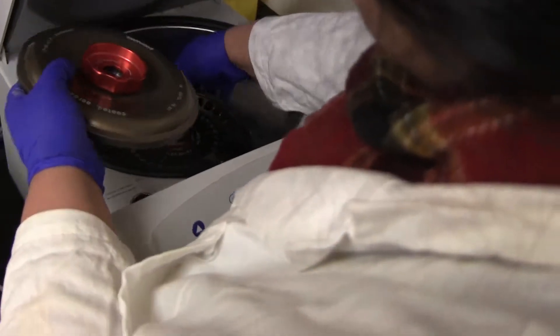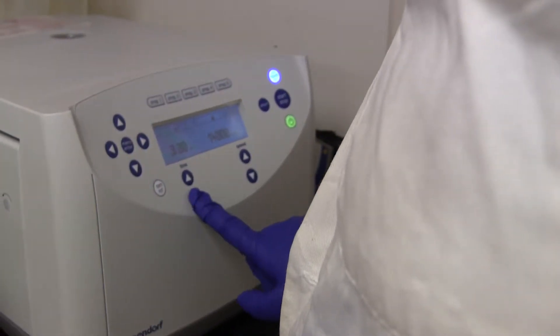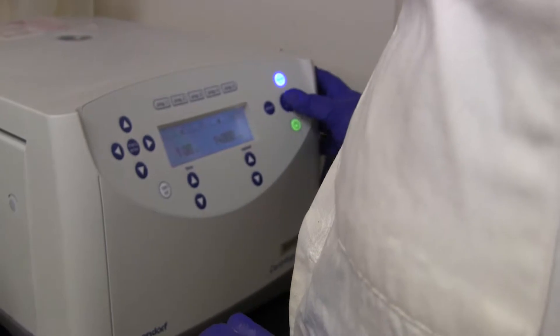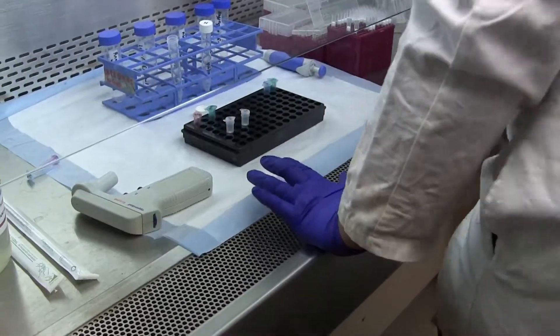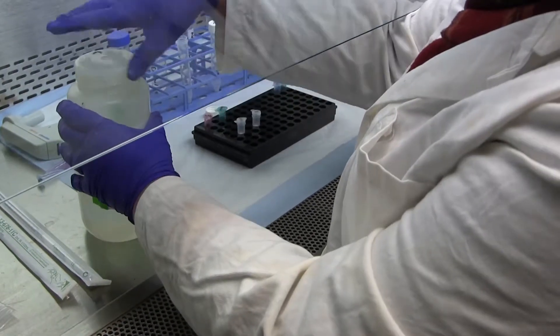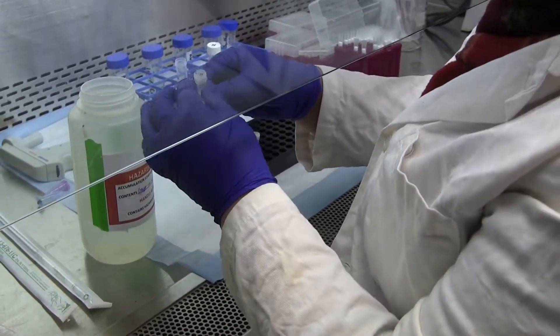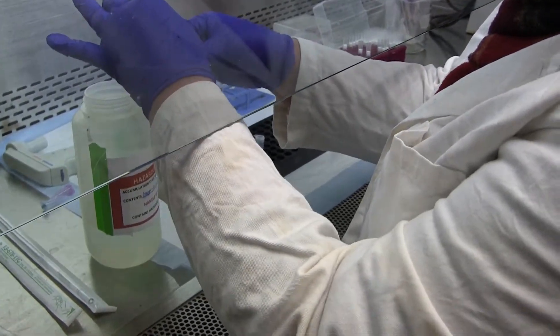So next step is to centrifuge. Make sure your lid is on, tightened, one minute. So after centrifugation, you want to dump the filtrate into the hazardous waste container because it contains lysis buffer.